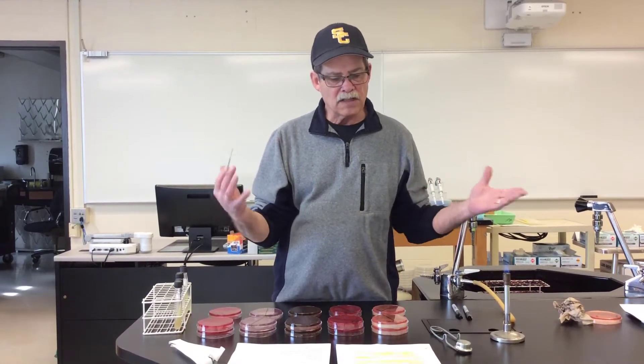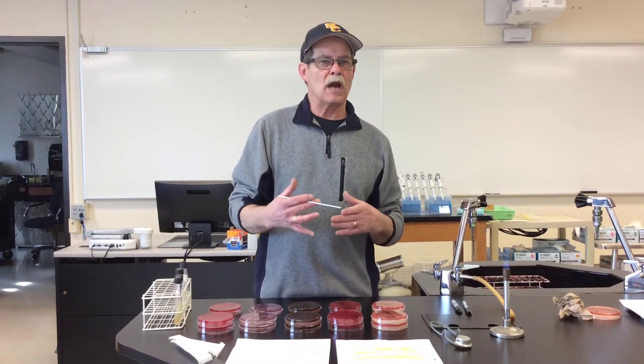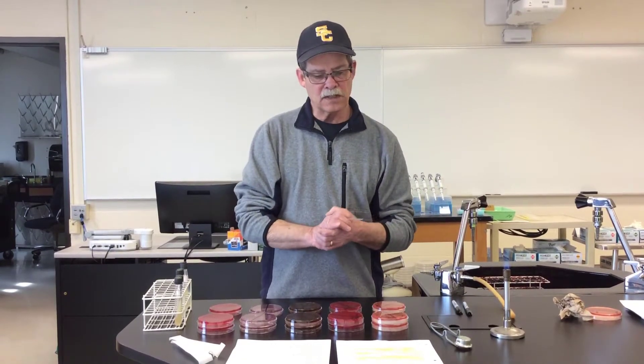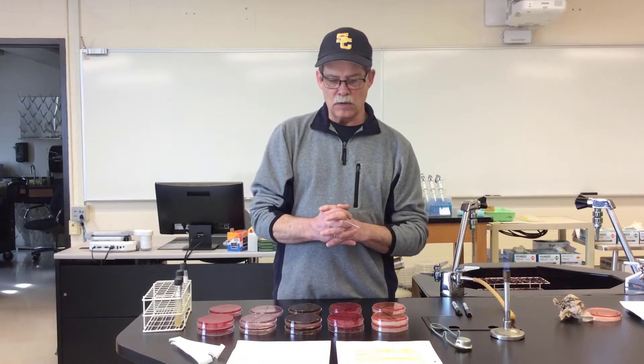I think you all know, having dealt with media, that microbiologists will use multiple types of media to try to get certain organisms to grow, or perhaps to determine particular biochemical activities of a particular organism. Many different kinds of media can be used. The three we're going to briefly mention today are selective media, differential media, and enriched media.